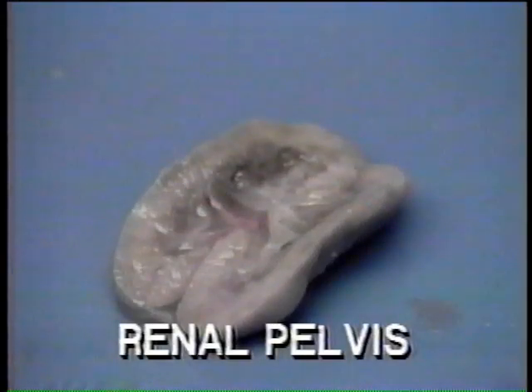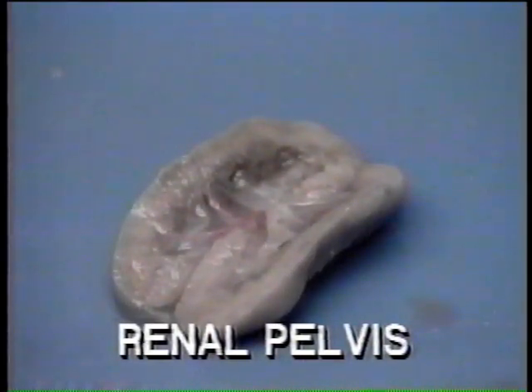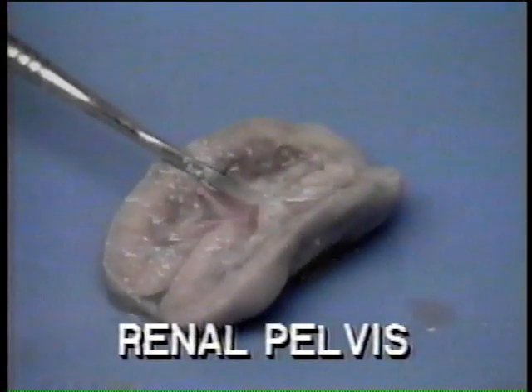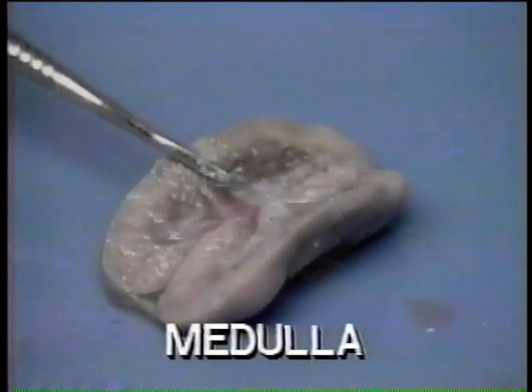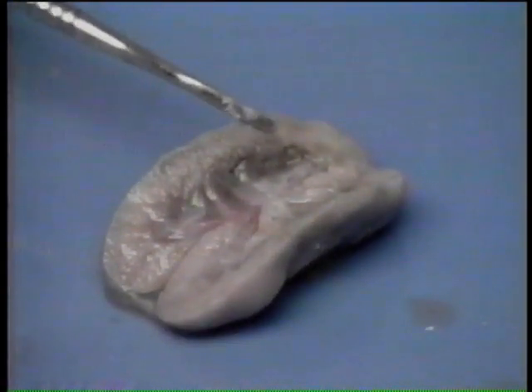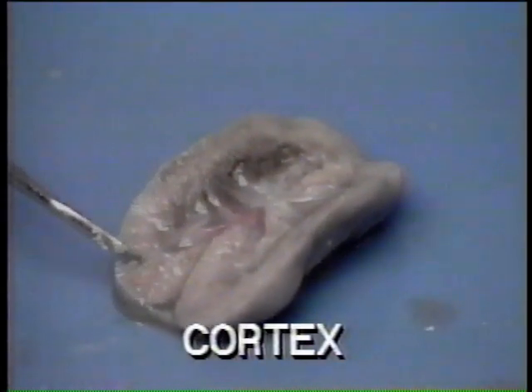Observe the renal pelvis, the expanded portion of the ureter within the kidney. The central part of the kidney is called the medulla. Surrounding the medulla is the area known as the cortex.